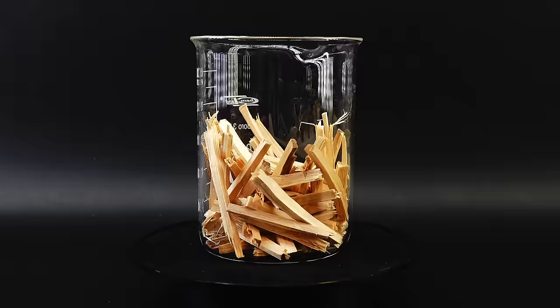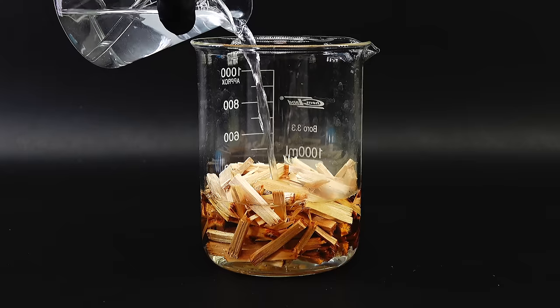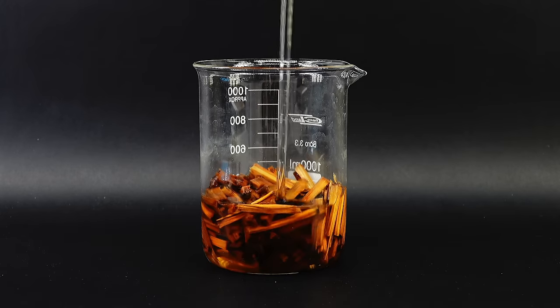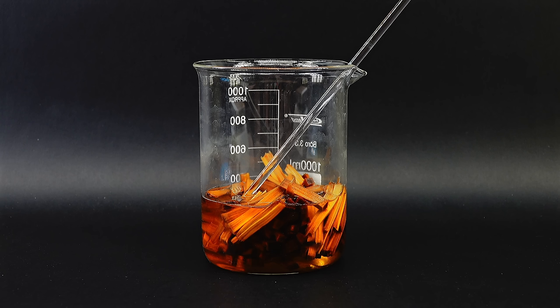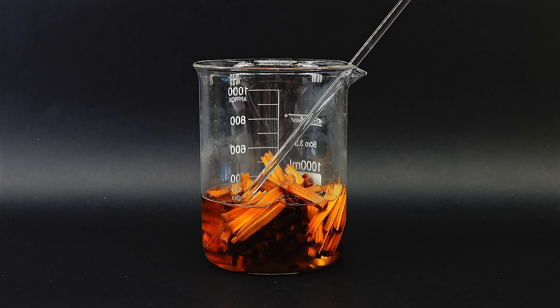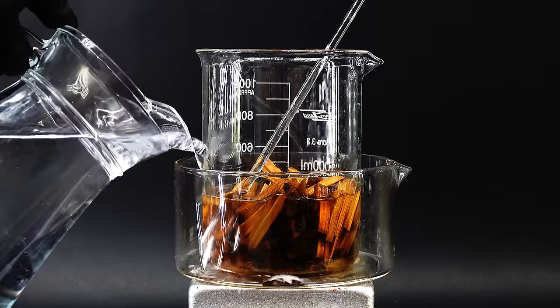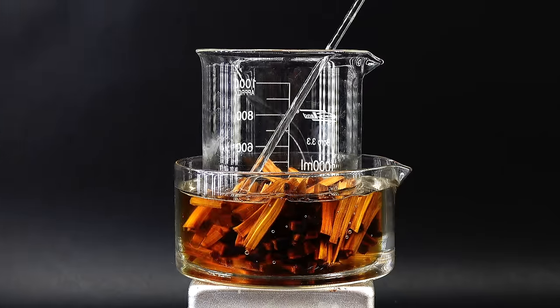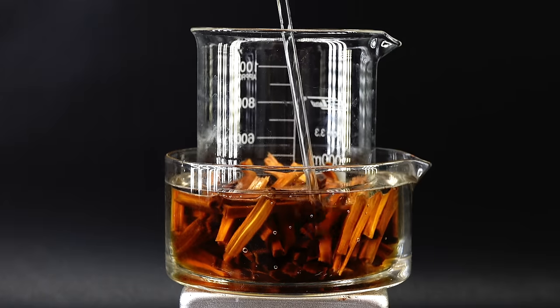To marinate my wood in it, I got 100 grams of it into a beaker and covered it with the sodium hydroxide solution. Since it had a ton of air trapped inside, it started floating on the solution's surface. After a few minutes, the whole mixture took on a brown shade, confirming that the lignin was being broken down and dissolved. To speed up this reaction and allow the solution to penetrate deeper into my wood, I had to heat this thing up, and for that, I assembled the beaker into a water bath. It will heat it nice and evenly, while limiting the temperature to a comfy 100 degrees Celsius, preventing the sodium hydroxide from getting too crazy.